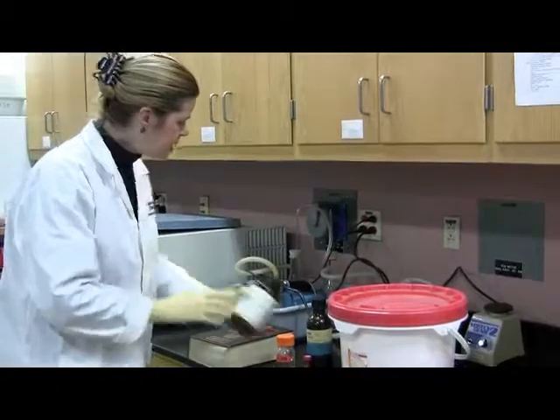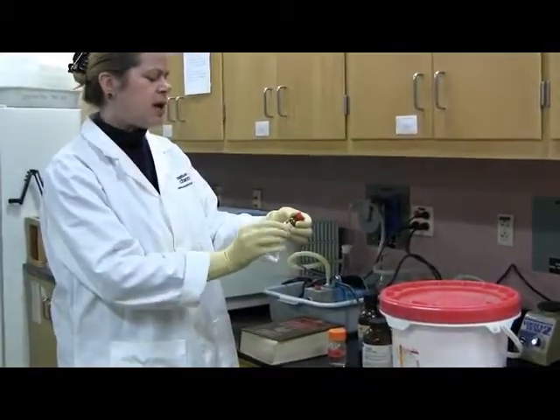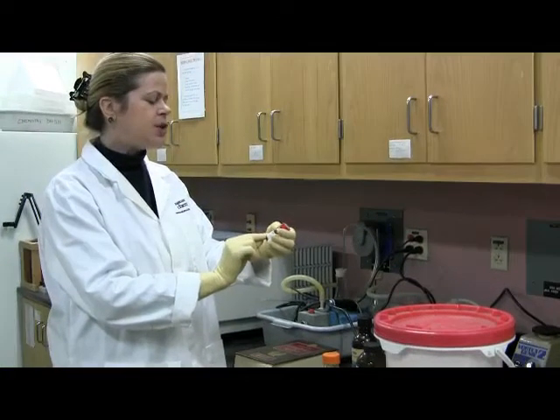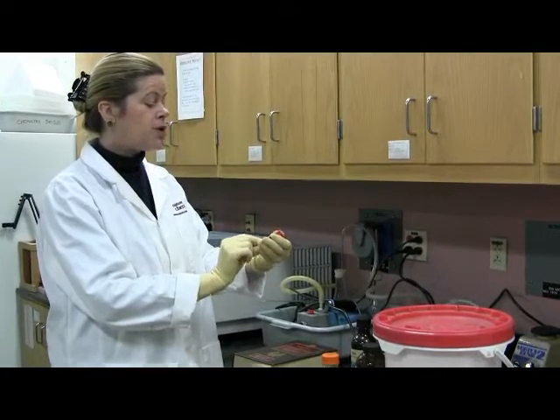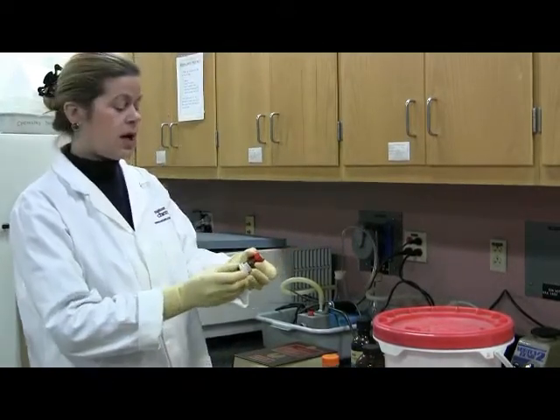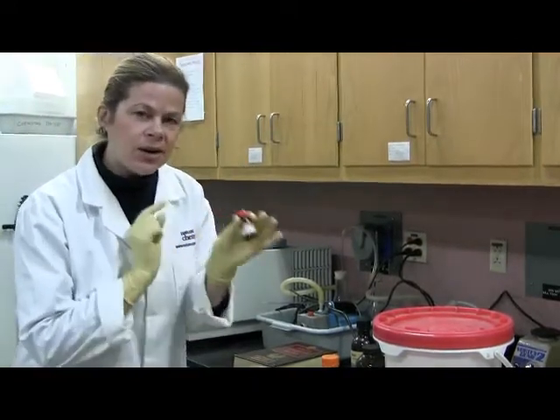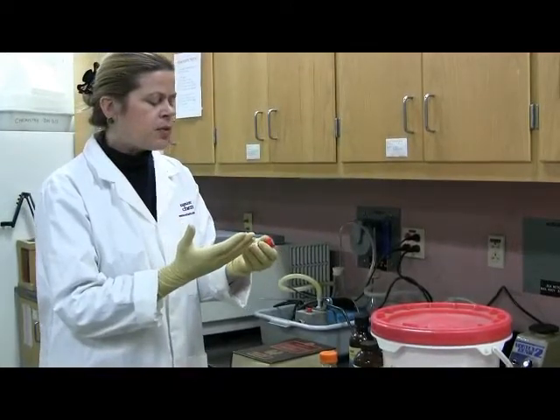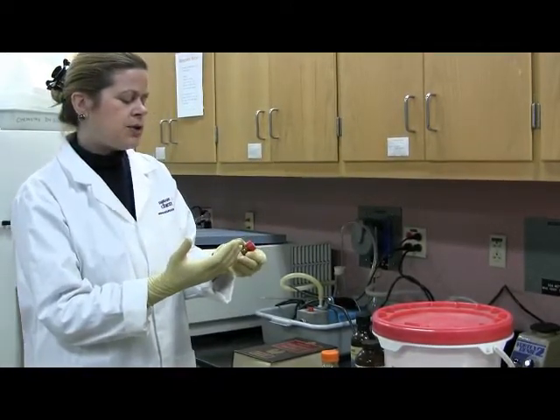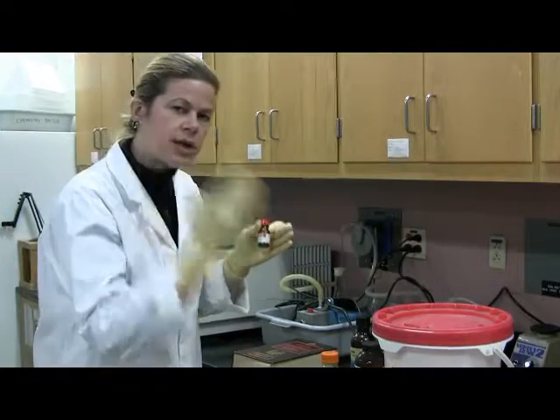All right, so we've got trypsin, and this one here is the substrate for the enzyme. N-alpha benzoyl DL-arginine 4-nitroanilide. Okay, and what is this? This is a peptide analog. Okay, basically what this has, you notice that I mentioned arginine. Okay, so there's an arginine and there's a site on this molecule that trypsin can cut.